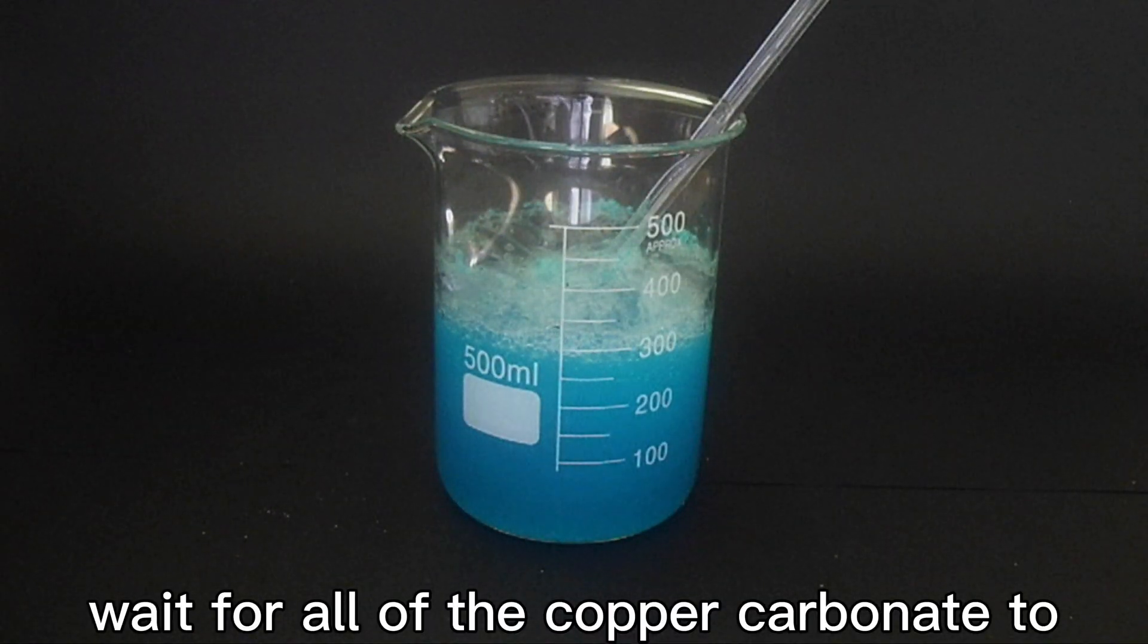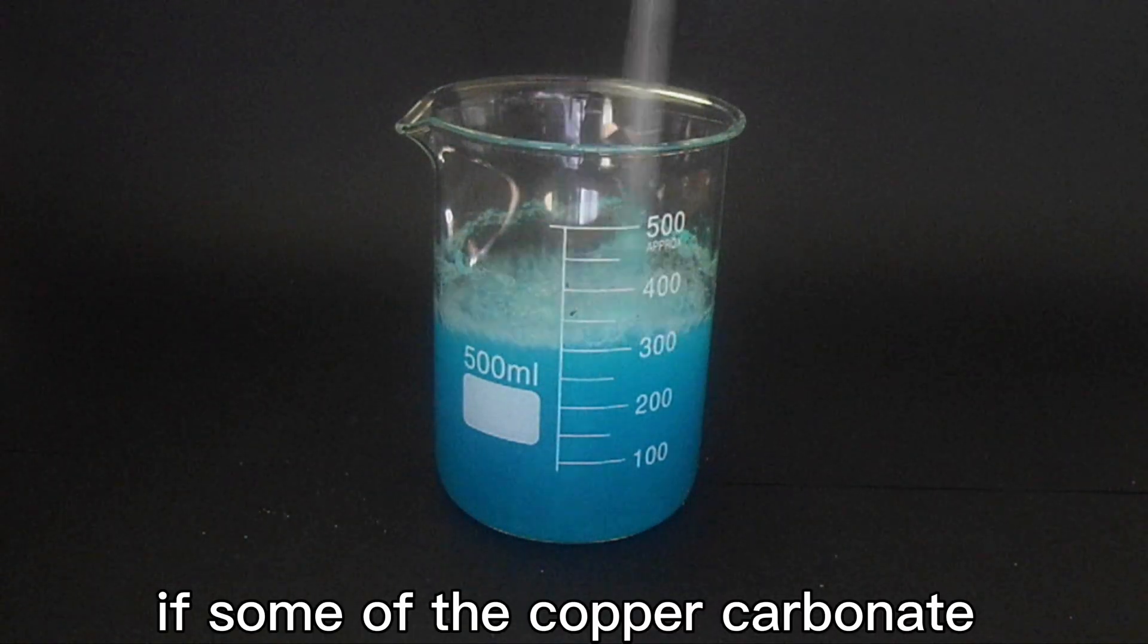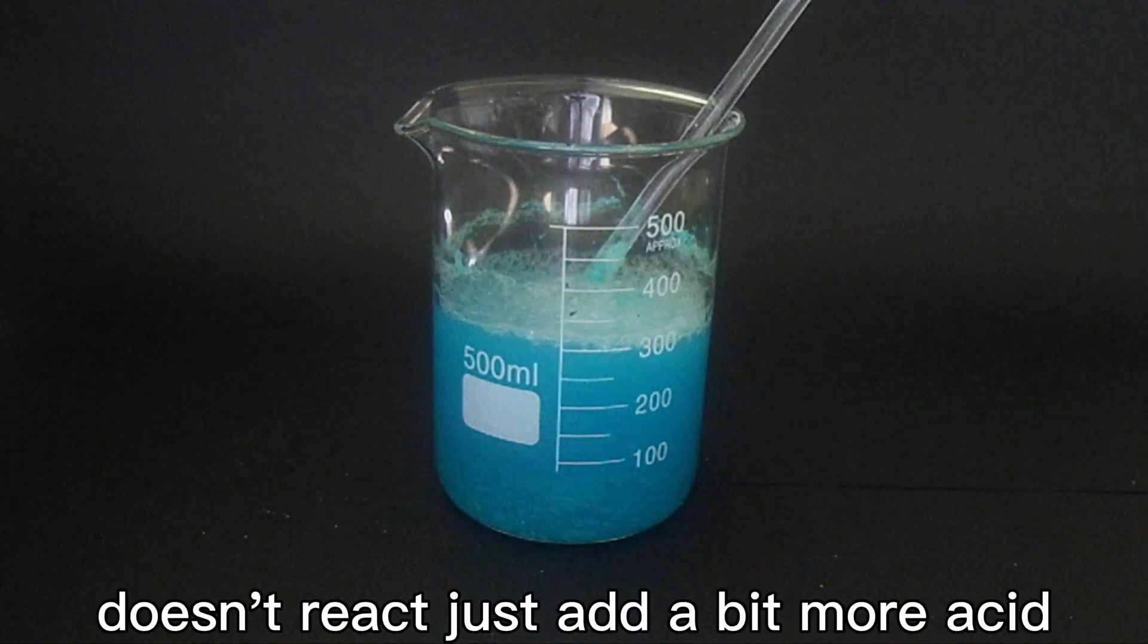Wait for all of the copper-carbonate to react while applying constant stirring. If some of the copper-carbonate doesn't react, just add a bit more acid.